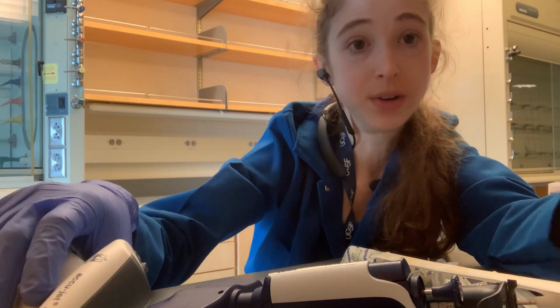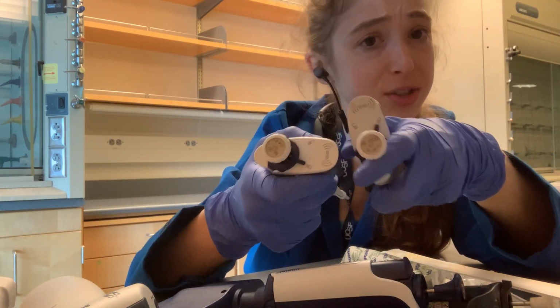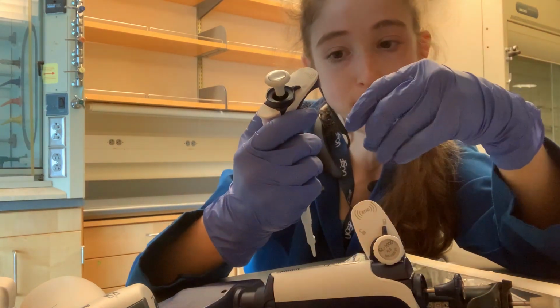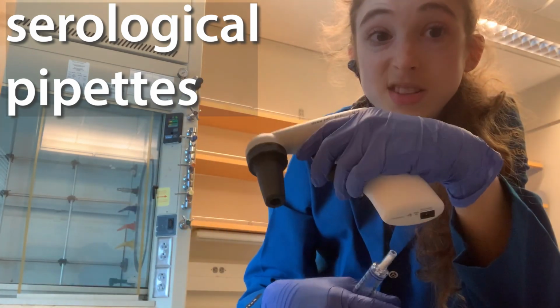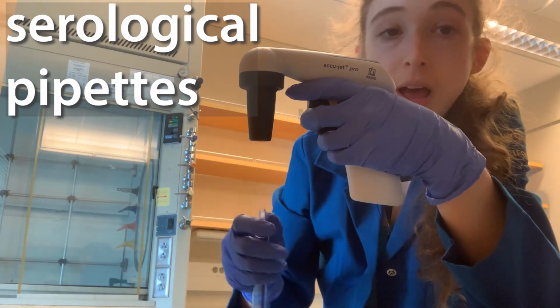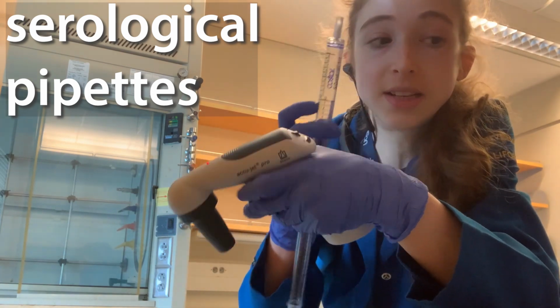So back to pipettes. When we're doing these really small volumes, when we're pipetting with the micropipettes, we typically really do care about that precision. We care about how fine we can get with these measurements. With the pipette aid that you use with the serological pipette, basically this is just replacing one of those sucker things in one of those bulbs. All it's doing is pulling liquid up. It's going to pull up until you tell it to stop, and you tell it to stop based on the lines of one of these.